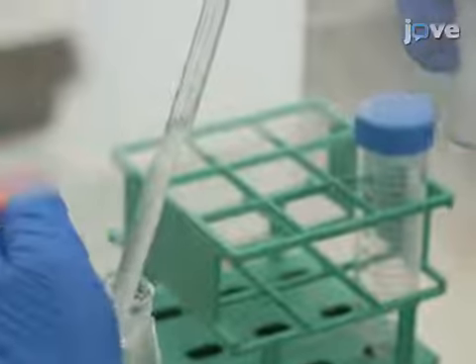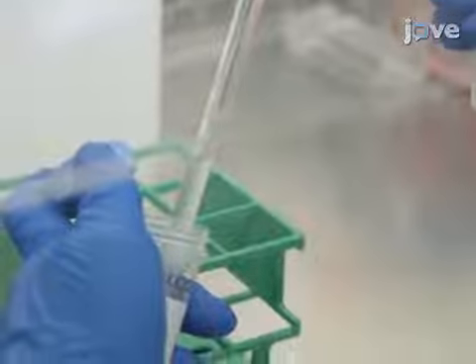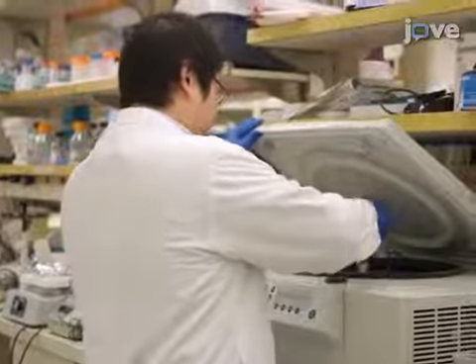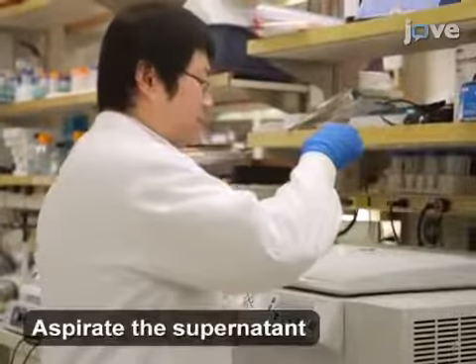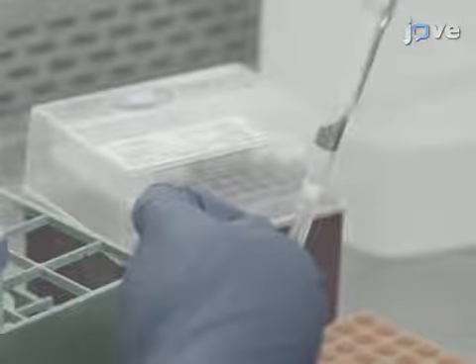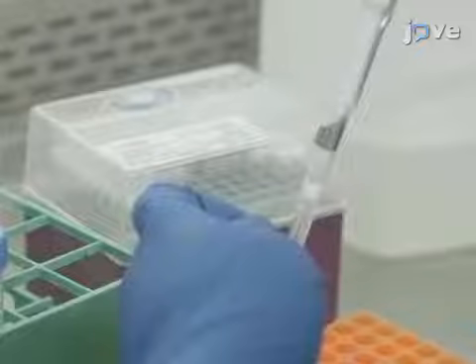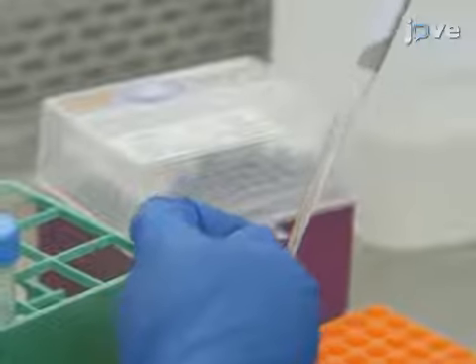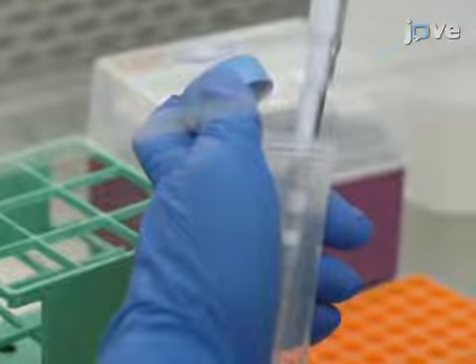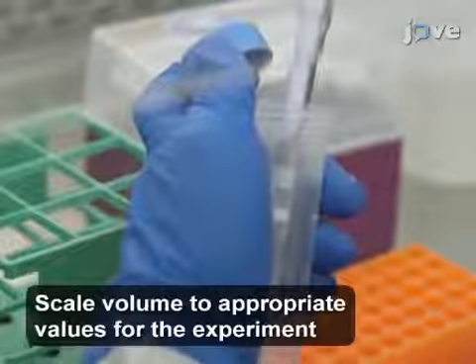Pipet out sufficient bacteria for an MOI of 10 to 1 into a new centrifuge tube. Then pellet the bacteria at 3000 times G for 10 minutes. To opsonize the bacteria, add 50 microliters of human serum to 450 microliters of RPMI 1640 and use it to resuspend the bacterial pellet at a density of 1 times 10 to the eighth bacteria per 500 microliters of medium.